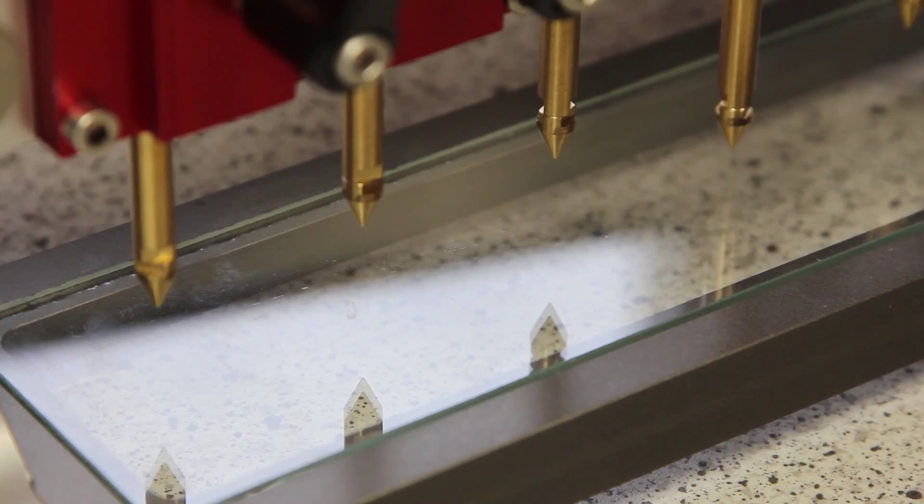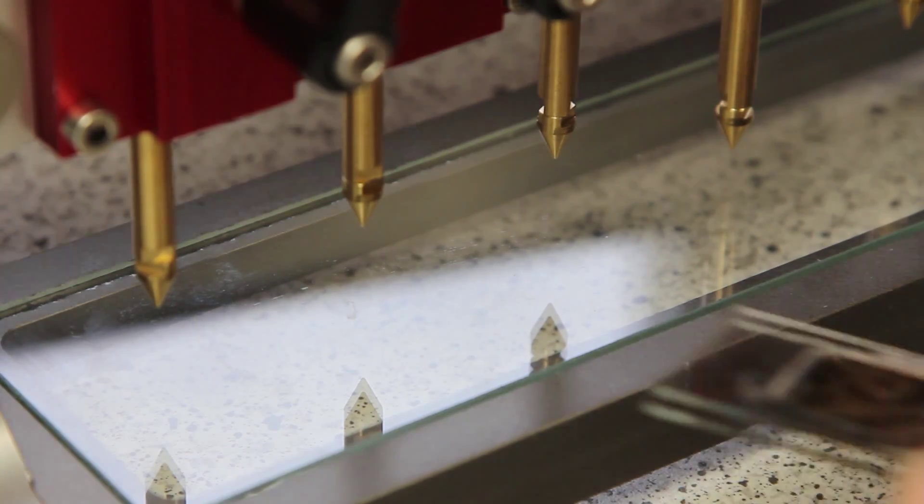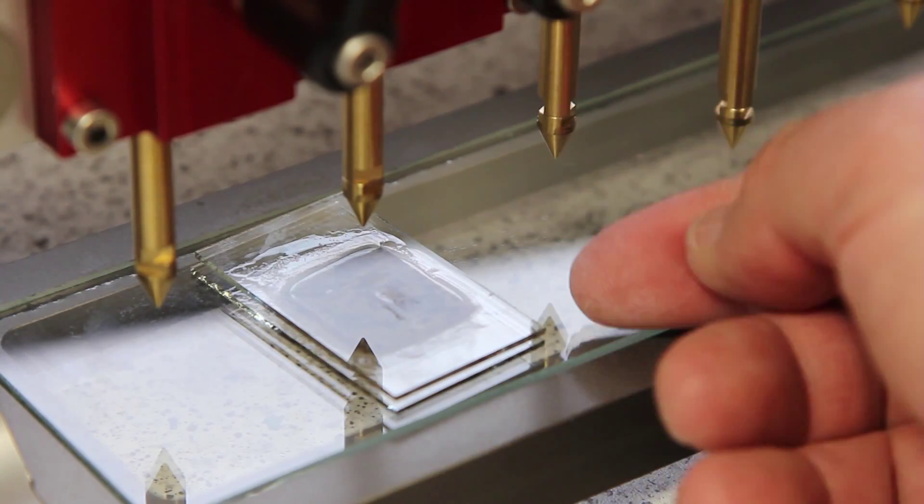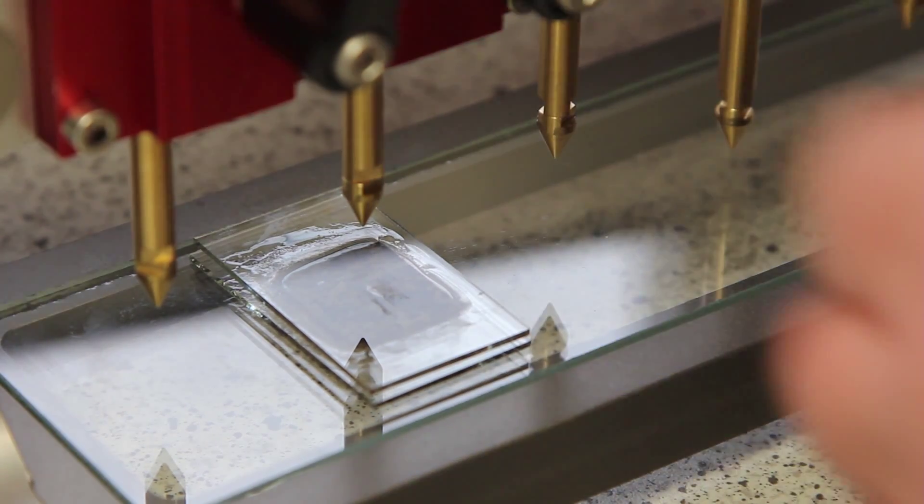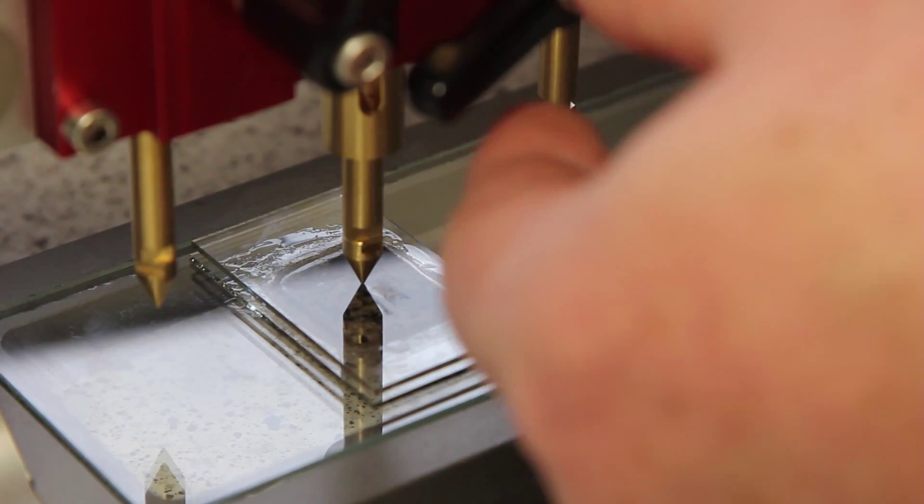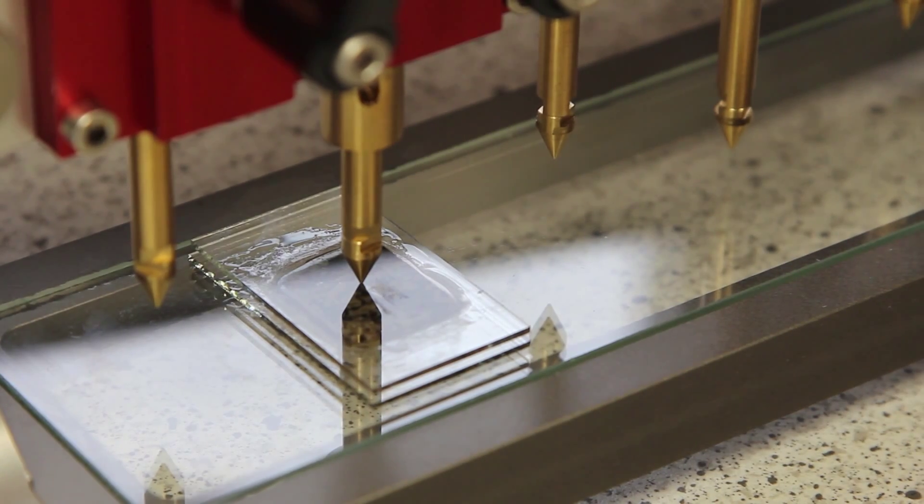Then I turn the sample upside down and I put it carefully into the jig. I close the jig.